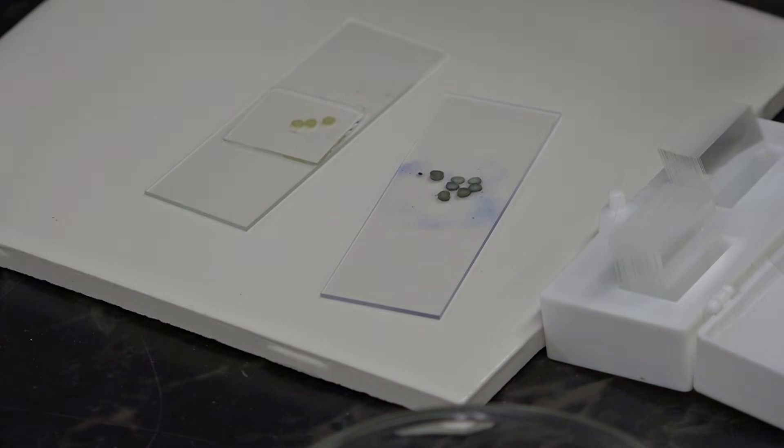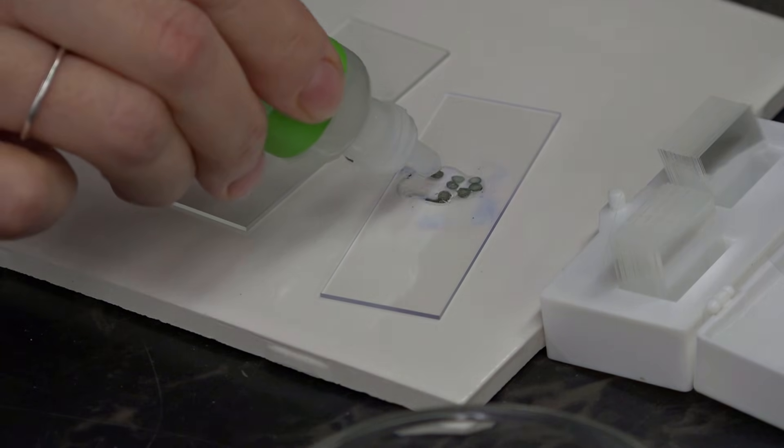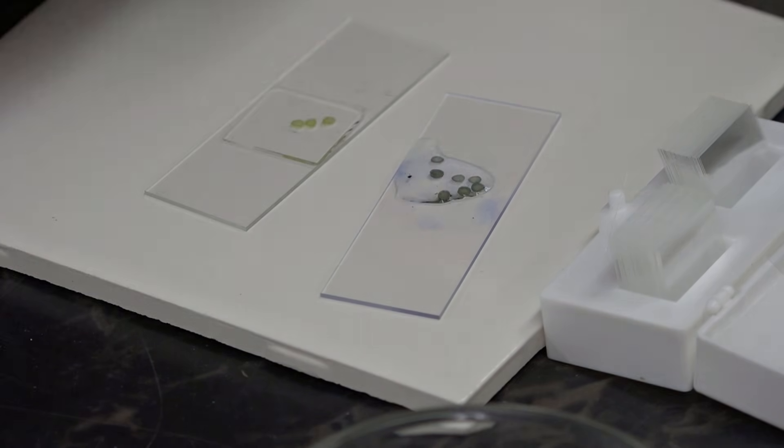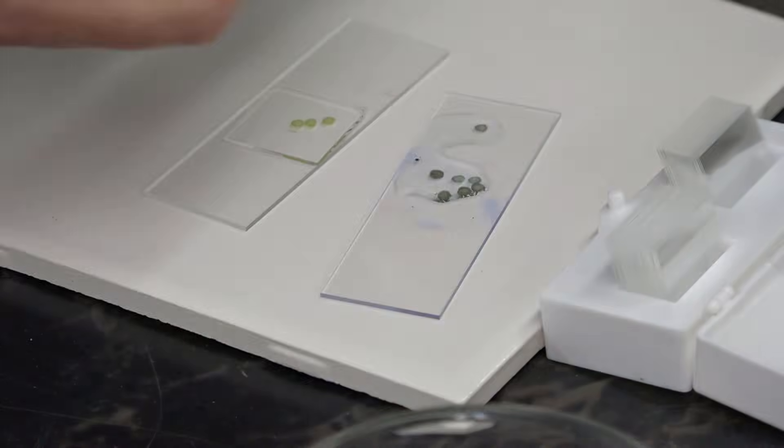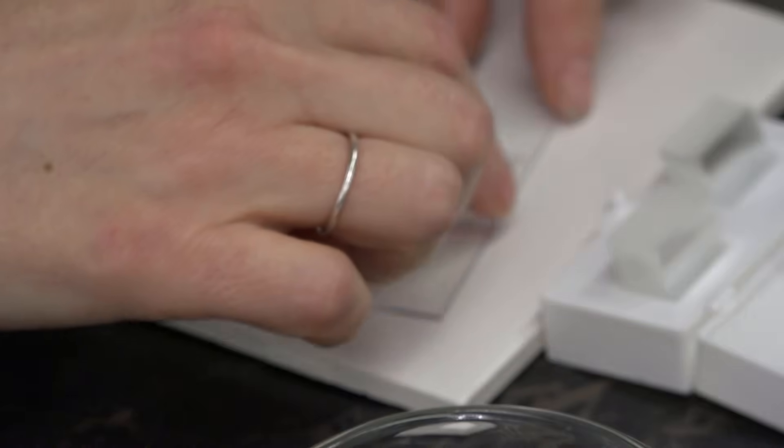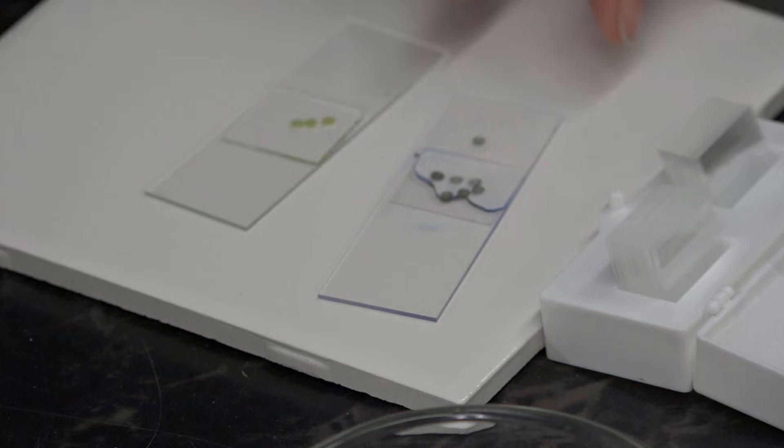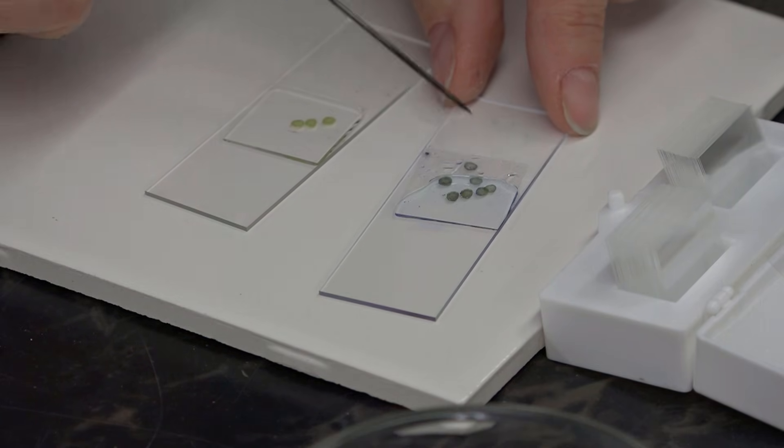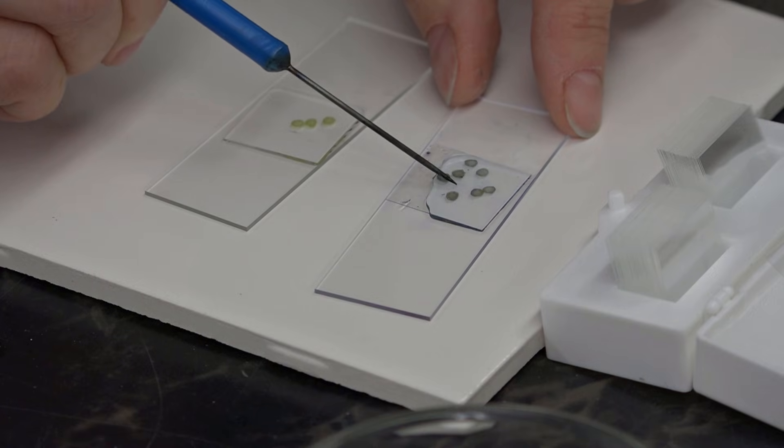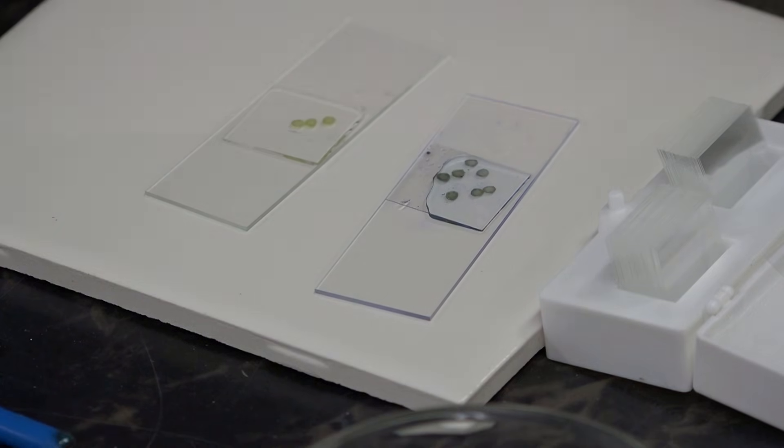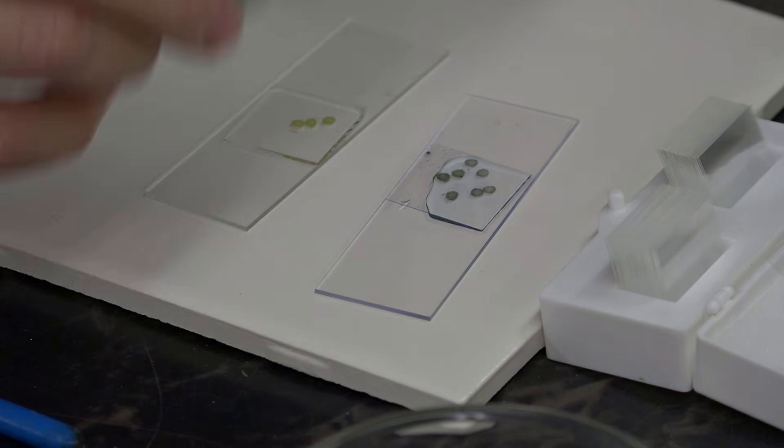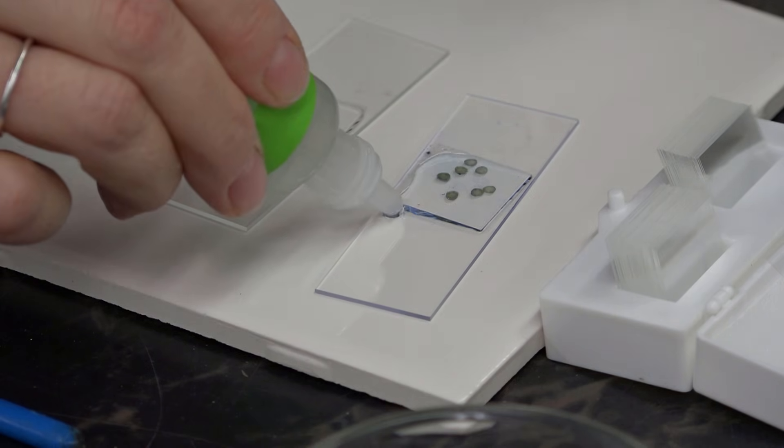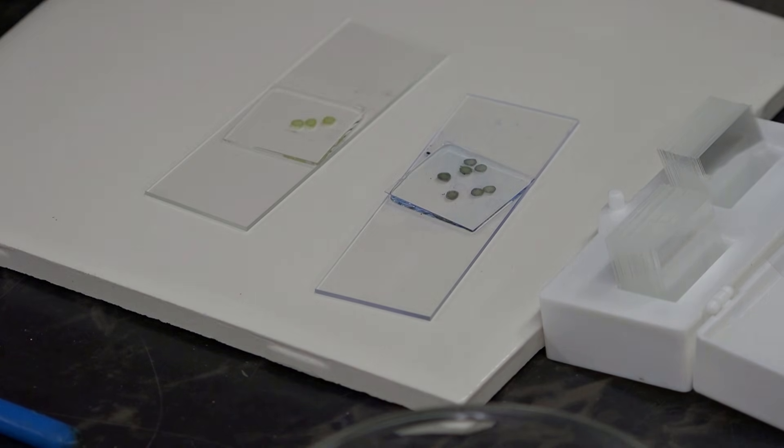Add the water. Cover slip. We lost one. Let's get that back in there. And we're ready to look.